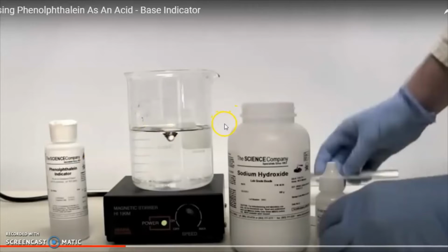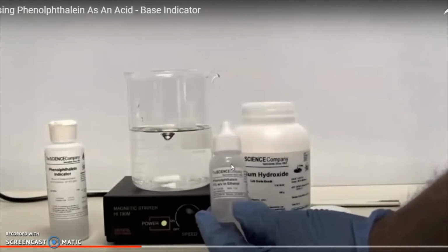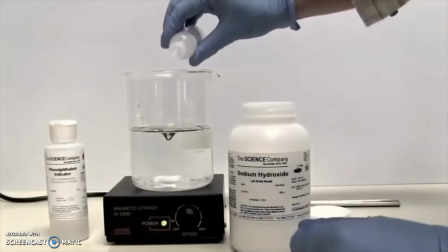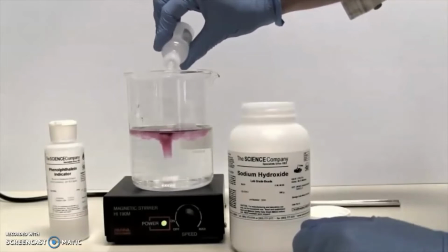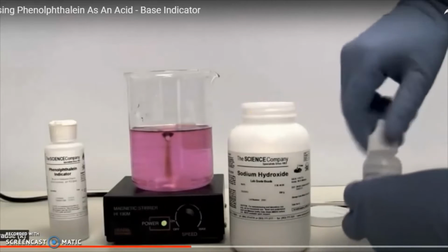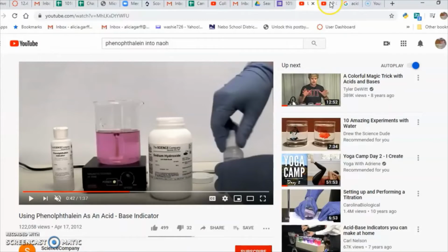When I push play here, you're going to see this person add the phenolphthalein, and then the solution is going to turn pink because it's basic. So there's the phenolphthalein, adding it to the sodium hydroxide, and notice we get a nice pink color. So that's one indicator. Let me show you a different indicator.